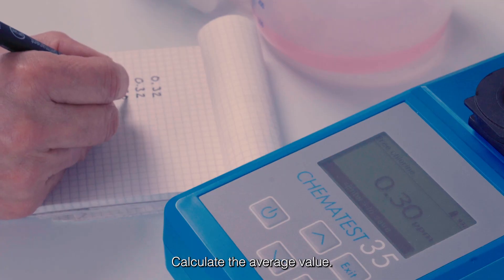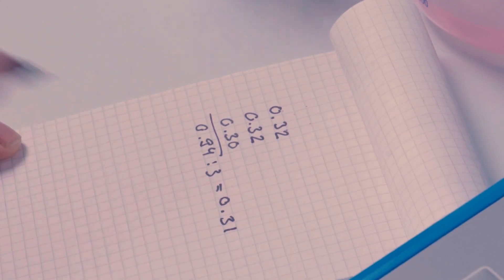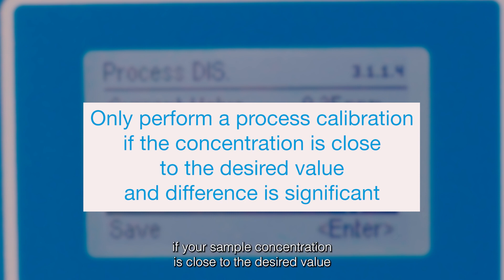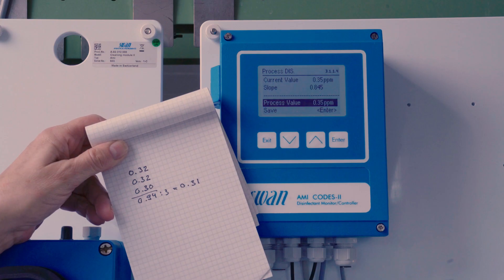Calculate the average value. Only perform the process calibration if your sample concentration is close to the desired value and if the difference to the manual measurement is significant.